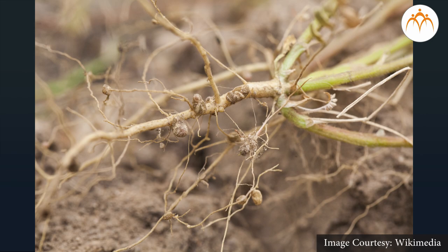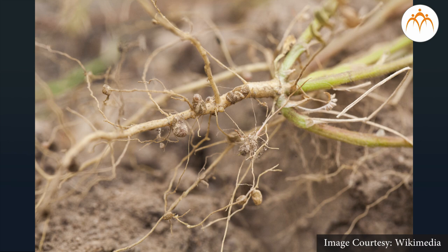Remember that rhizobium can do nitrogen fixation only when it is inside the roots of leguminous plants. Now let us proceed and see how to prepare a slide of rhizobium bacteria. Procedure: First, take a rooted plant of fenugreek, peanuts, or beans that has nodules on it. Clean the roots with water and then sterilize them with 3-5% hydrogen peroxide solution. Sterilization is necessary to remove other types of bacteria present on the root surface which come from soil. Then dip the roots in 70% ethyl alcohol to sterilize the root surface for 4-5 minutes, and wash the roots with sterilized water. Now cut the root nodules into thin slices with the help of a new razor blade. These are called sections.